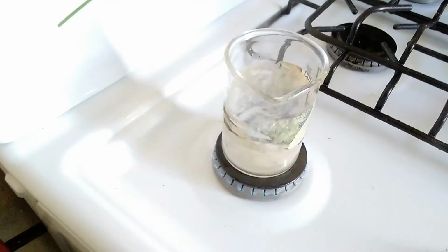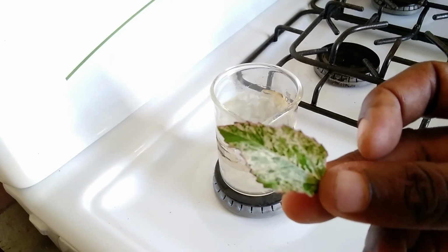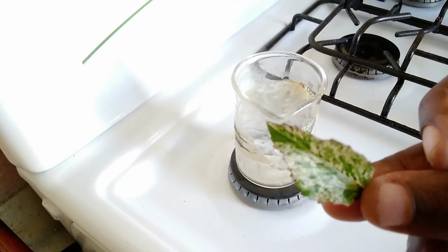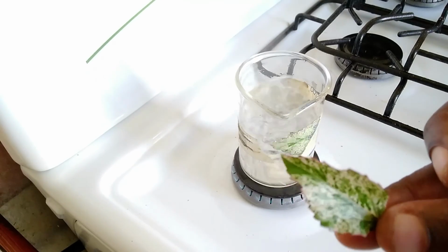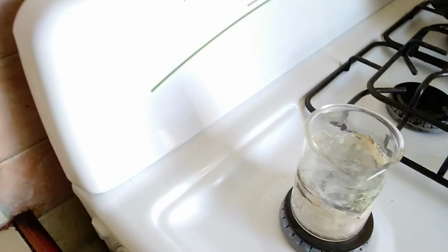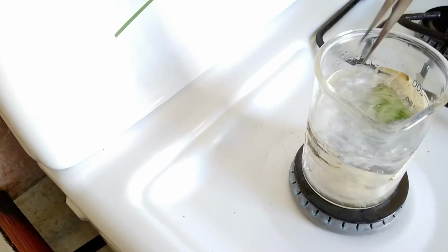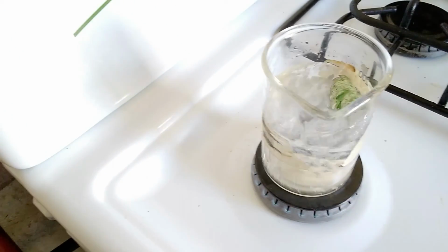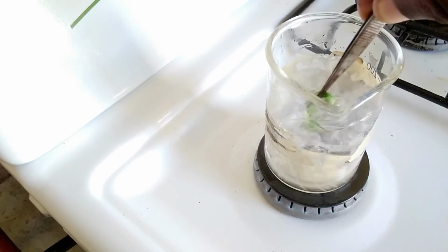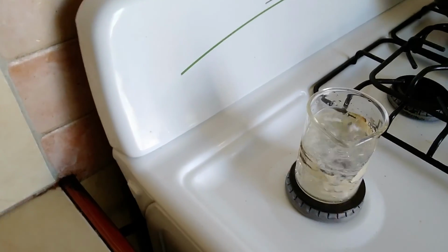One other thing that we want to explain, the first thing we wanted to do, in a matter of fact, was to ensure that we have an appreciation of the color of the leaf. This is going to be our first observation, so we need to write this down. What is the color? And then at the start, we needed to know what was the color of the water, because we really don't want to make any mistake. So the first step here is to find out why we had placed this leaf in the water. So you have to figure that out or do some research. All right, we're going to continue. So that one is in the water, and you need to tell me why it's in the water there.